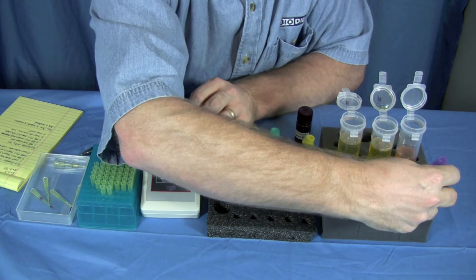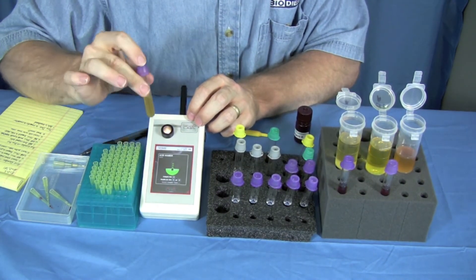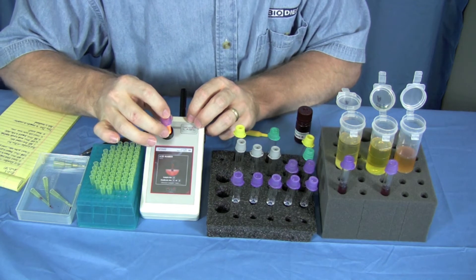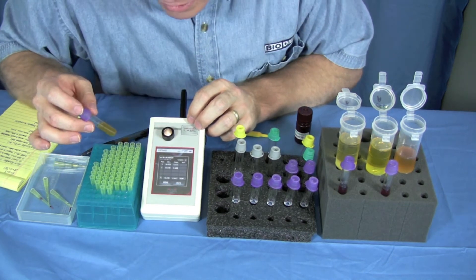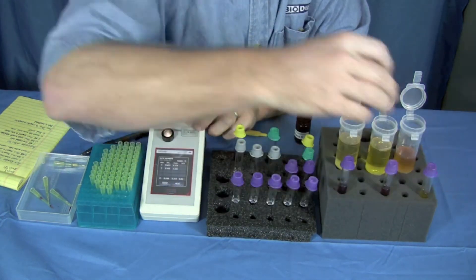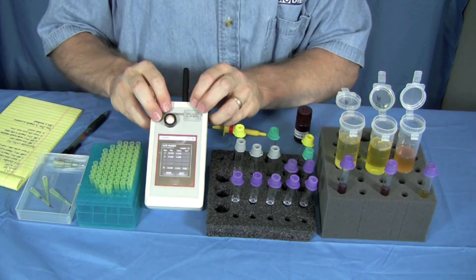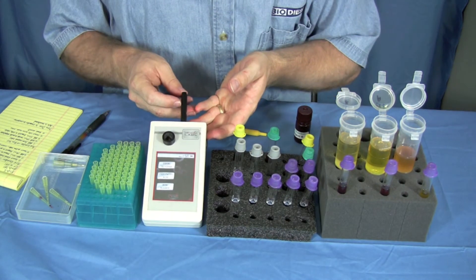Final sample. Put this one in, pull it out, in, out. This one was 4.441, much much higher. When you're done doing all your samples, press done and that's how to do acid number.